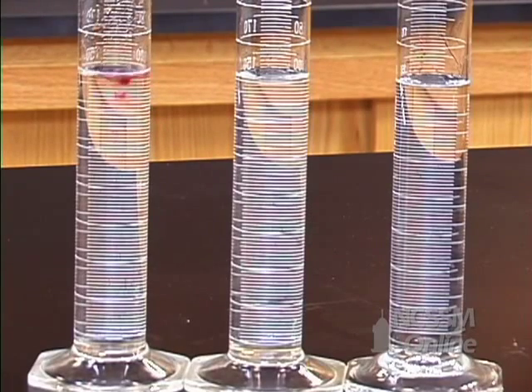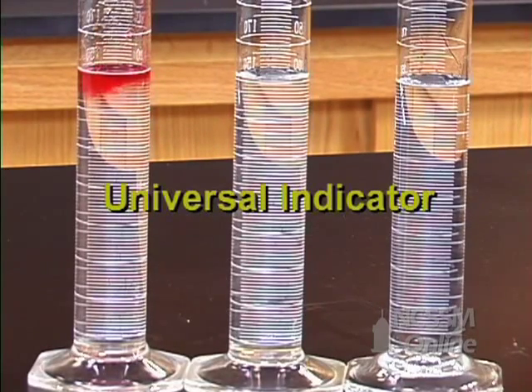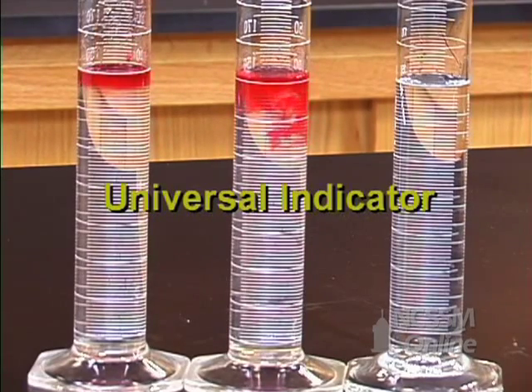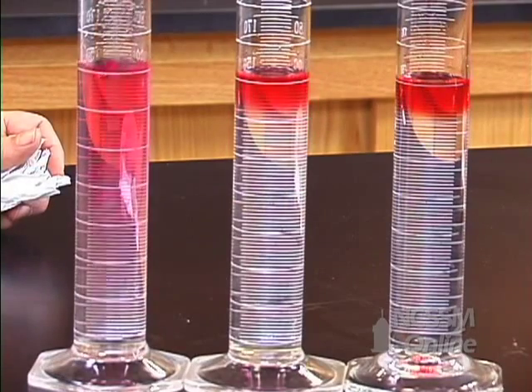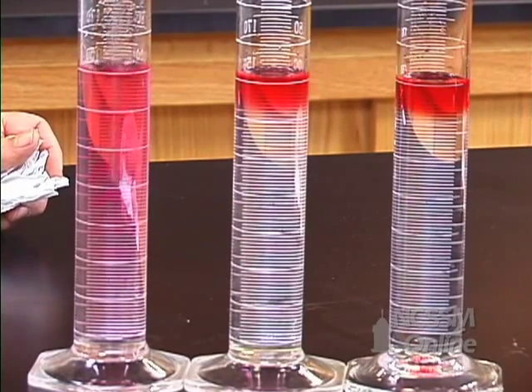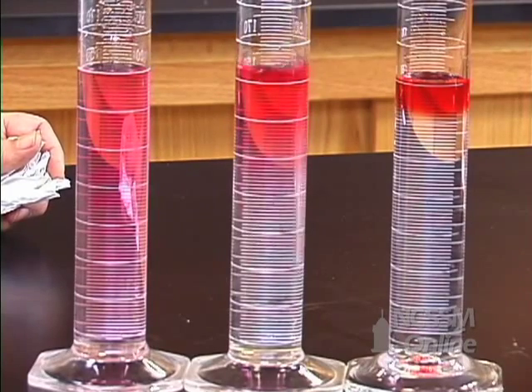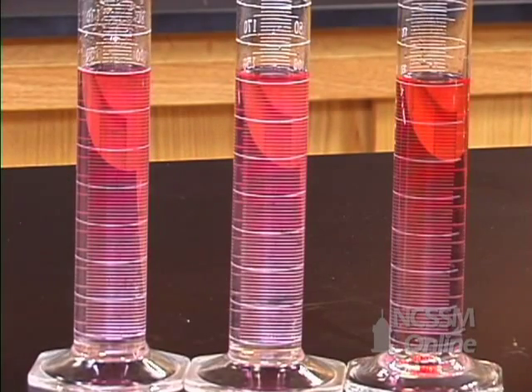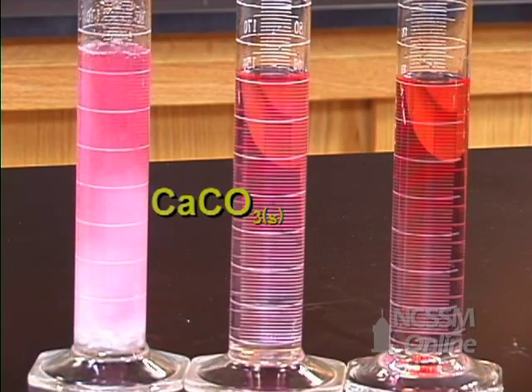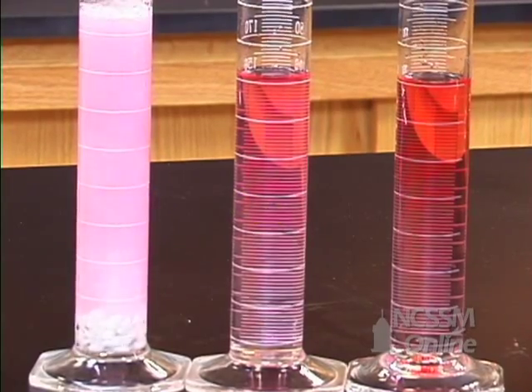I'm going to add a little bit of universal indicator to each of the solutions. I'm now going to add some solid calcium carbonate to each one of the graduated cylinders. What we want to do is look at the rate at which the carbon dioxide is produced, which would be dependent upon the hydrogen ion concentration in each of the graduated cylinders.